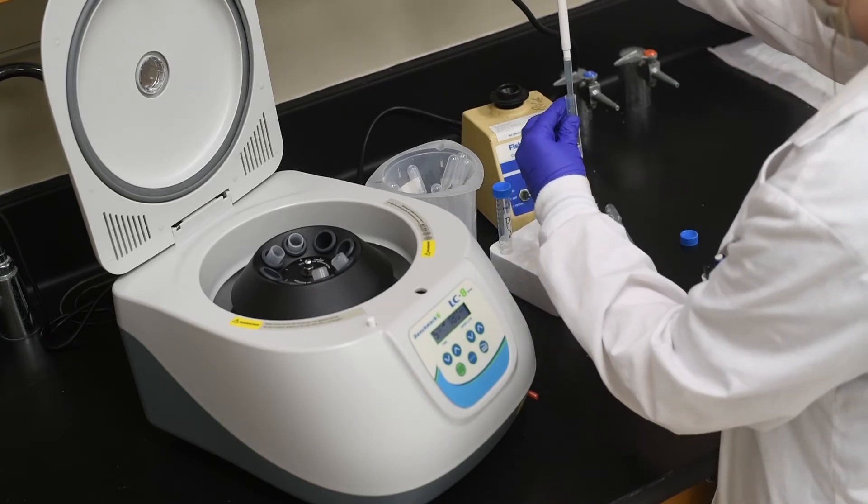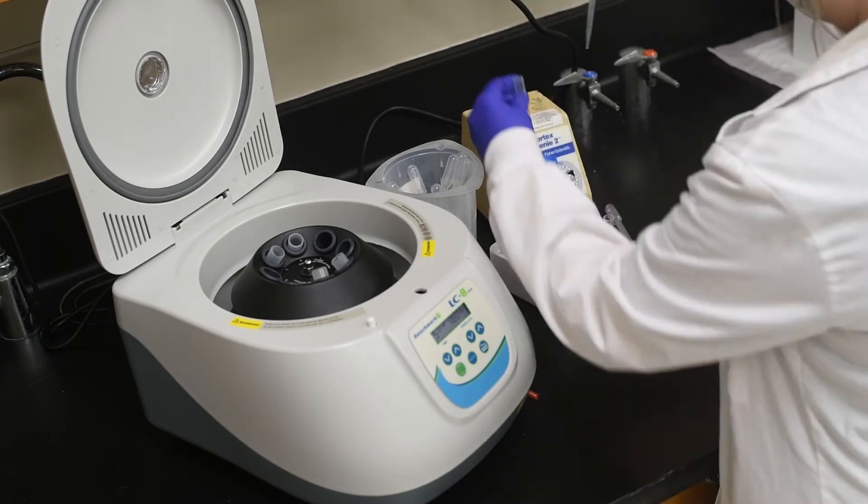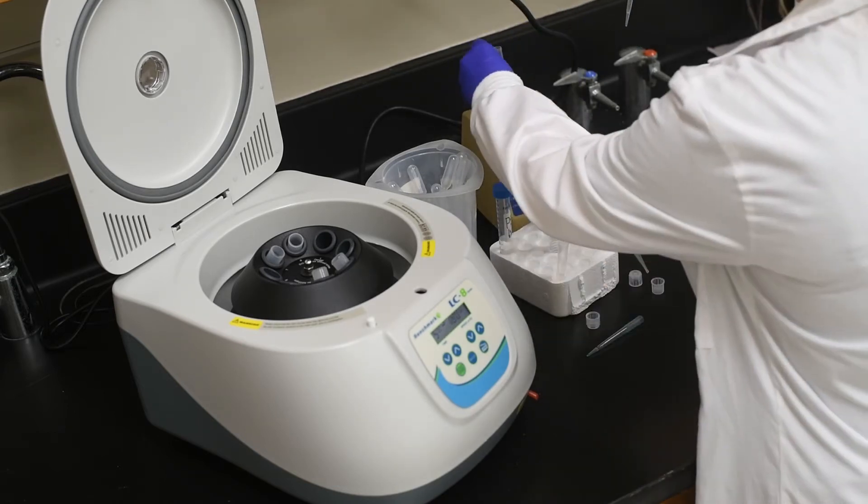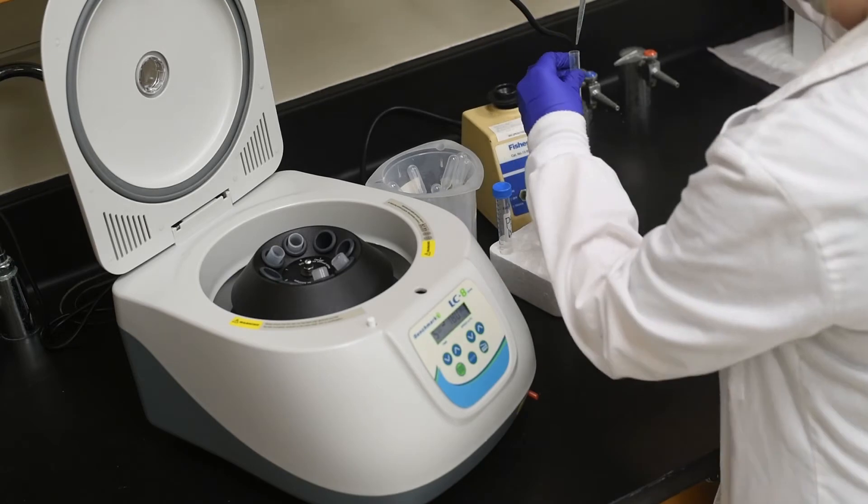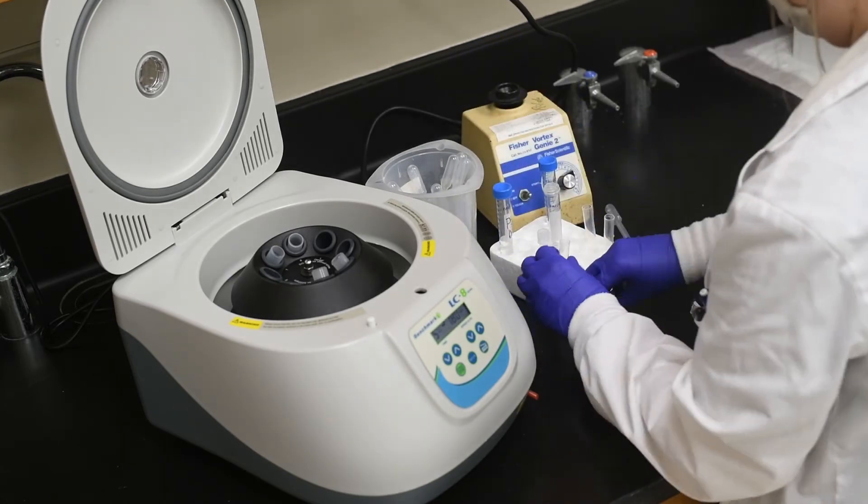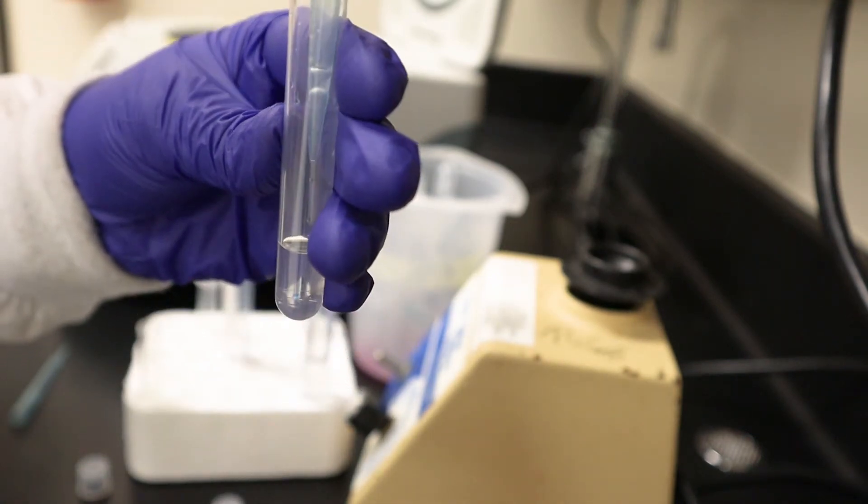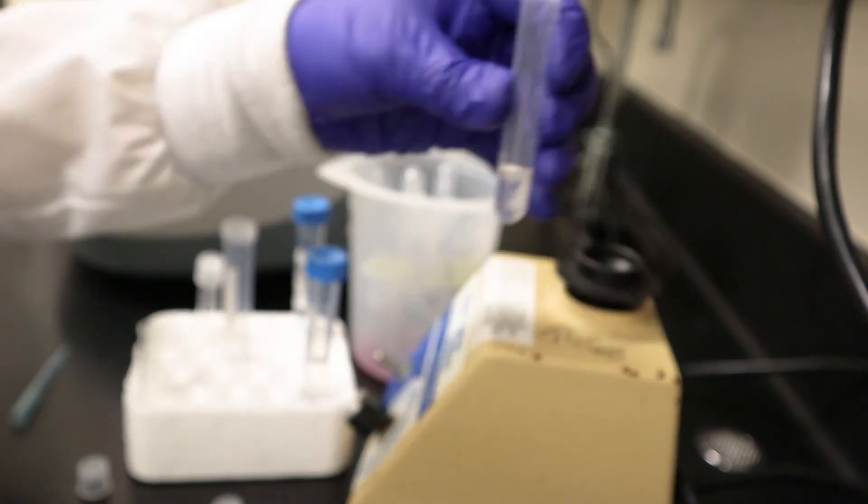After each drop was added, the suspension was vortexed. Here you can see with every drop the cloud that forms in the ethanol from the cells.